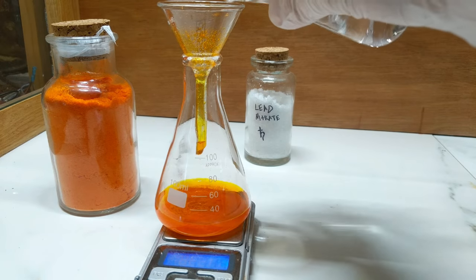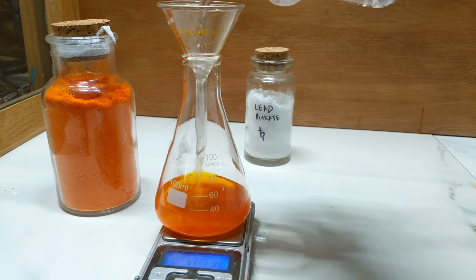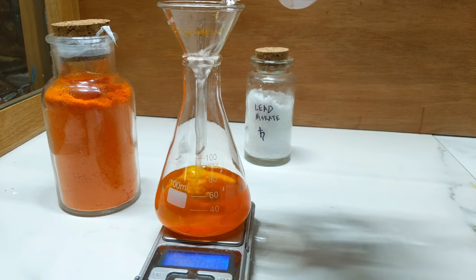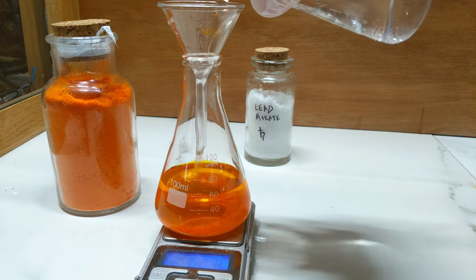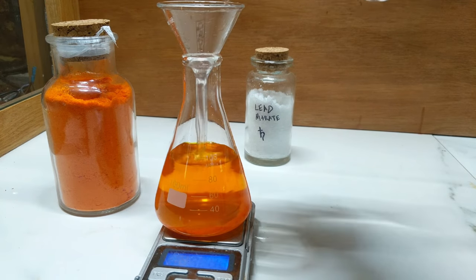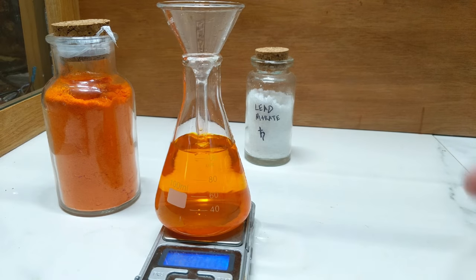I will also be diluting this down a fair bit to about 100 mils. The reason we want dilute solutions of our chemicals is so that we can get small precipitate particles to form.